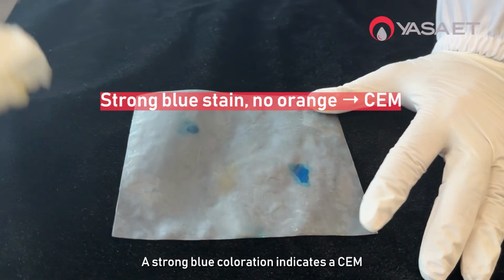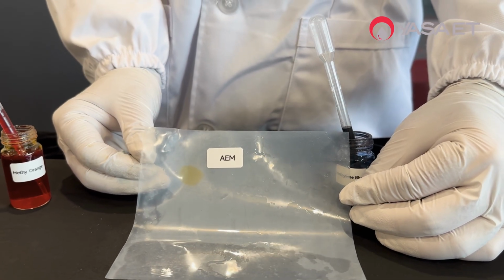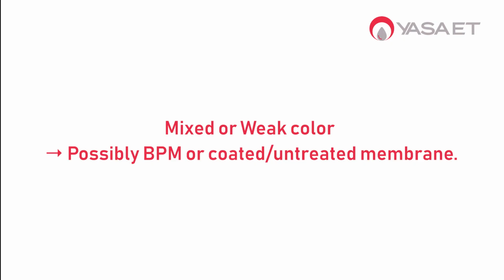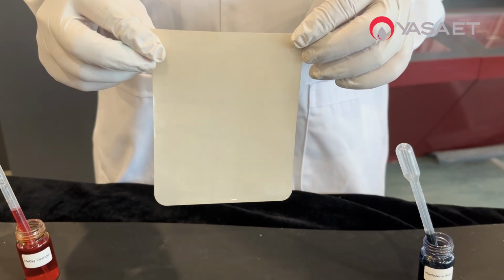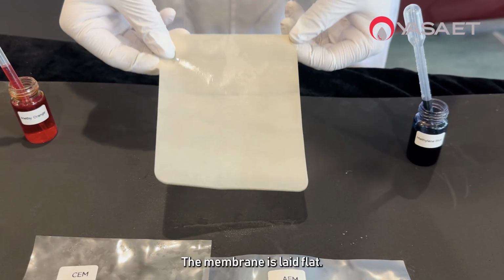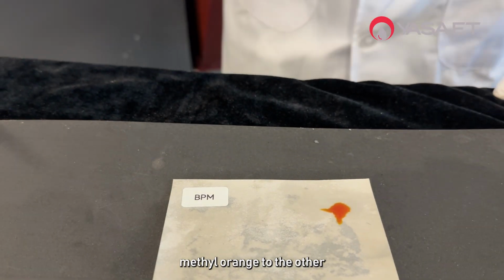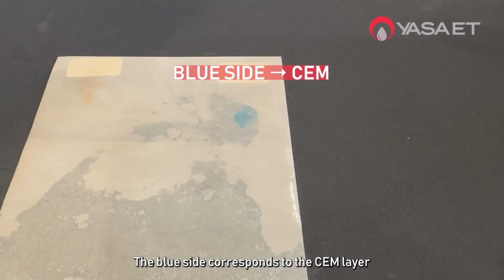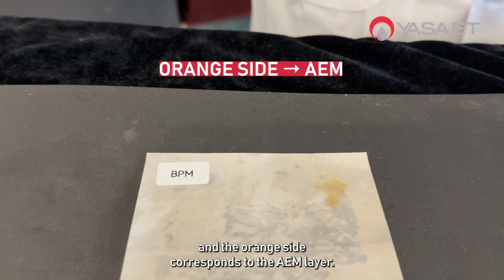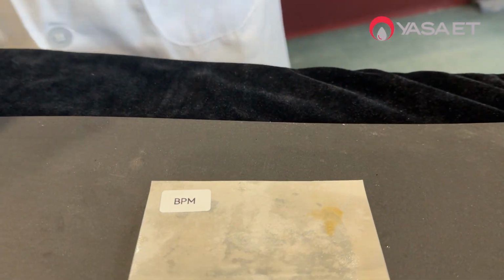A strong blue coloration indicates a CEM. A strong orange coloration indicates an AEM. Mixed or weak coloration may suggest a bipolar membrane or a coated surface. Method B. Dual dye orientation test. To identify BPM orientation, the membrane is laid flat. Methylene blue is applied to one side, methyl orange to the other. After staining and rinsing, the blue side corresponds to the CEM layer and the orange side corresponds to the AEM layer. This method provides immediate and clear orientation feedback.